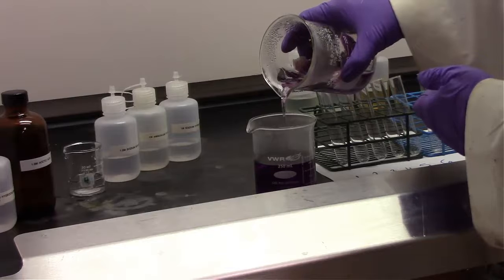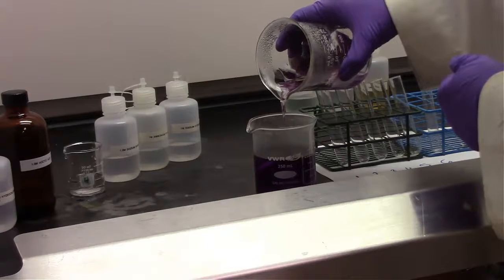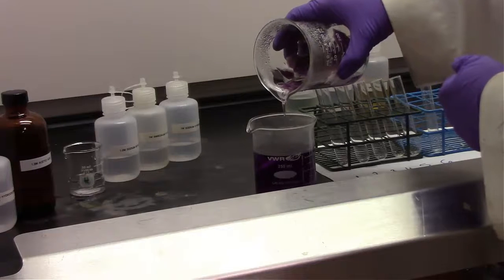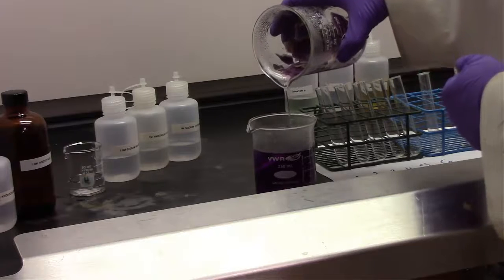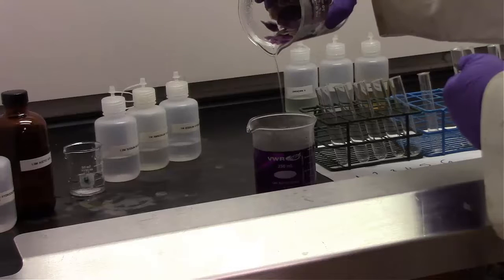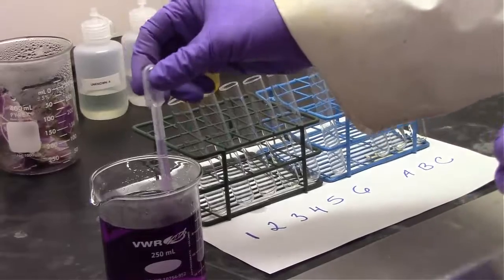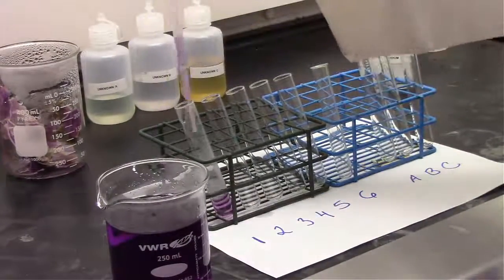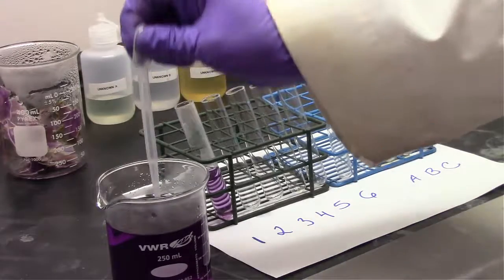We're isolating it from the peel by decanting. Another way to do this would be vacuum filtration, where we could actually separate the peel from the solution, but decanting is a little bit easier and faster, and since those cabbage peel portions are so large, it's very easy to separate the water from that. At this point, we can make our small library of references. So we're going to add some of this red cabbage solution to test tubes 1 through 6.